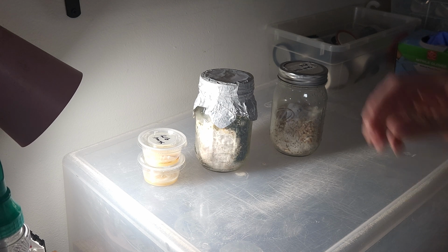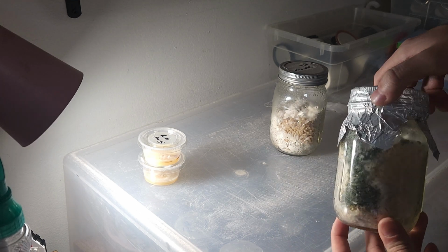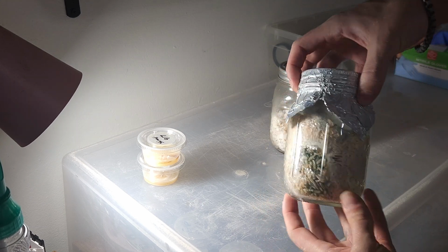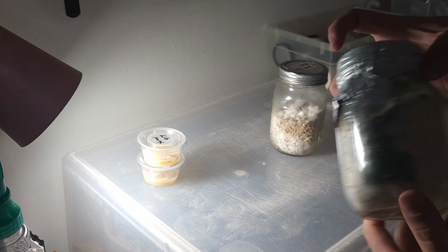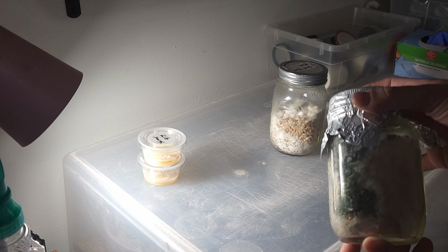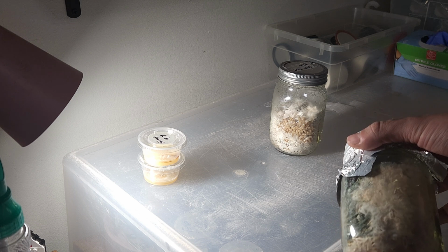And let's start with the bad news. Right here, we have a grain jar that did not quite make it and has been infected with trichoderma. And this one is pretty severe and is spread throughout the entire grain jar. Trichoderma is one of the more common forms of contamination that you can get and can affect you through the entire process, from your grain, your agar, and your substrate.